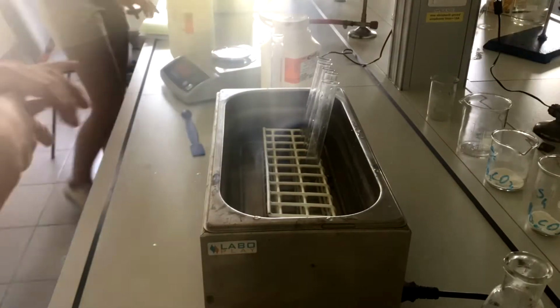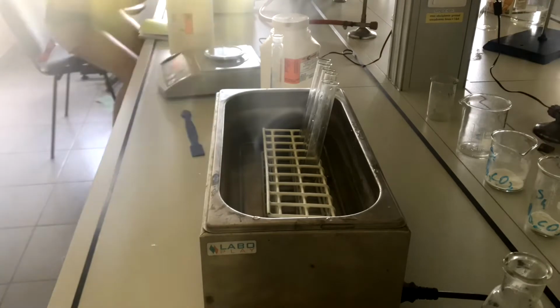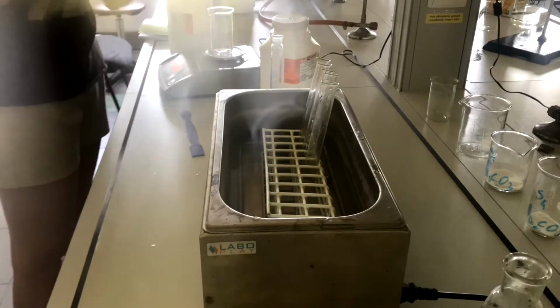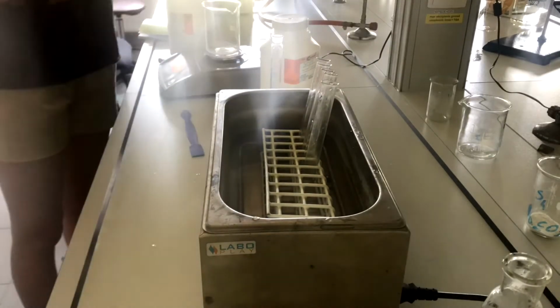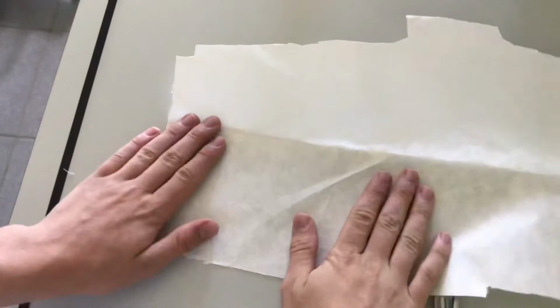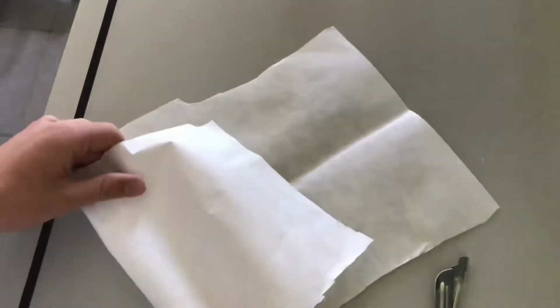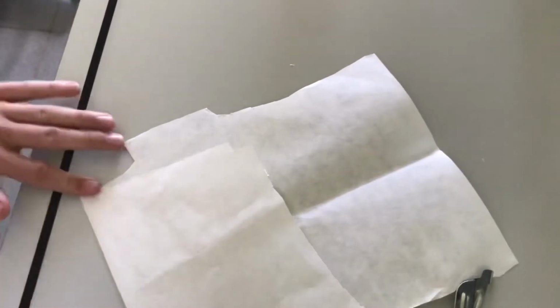It is then that I decided to go with a safer choice that I had not considered earlier, using smaller flasks and less water, this time just 5 milliliters compared to the 20 that I started off with. While the water was still heating up, I took up the job of making filters for the rest of the salt that would not dissolve in the water.